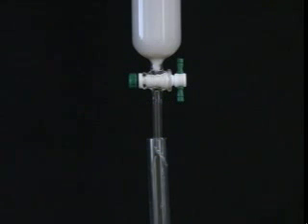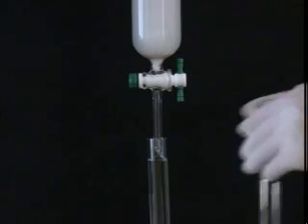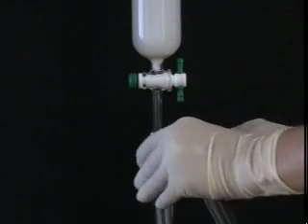Don't forget to continually collect the eluent in test tubes. You have to pay attention so that the solvent doesn't overflow and refill frequently.